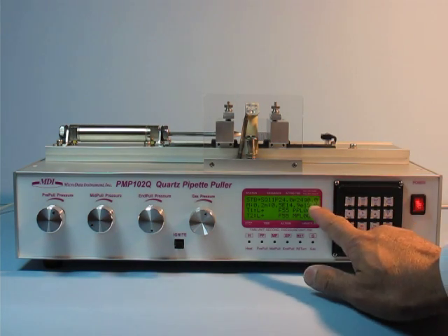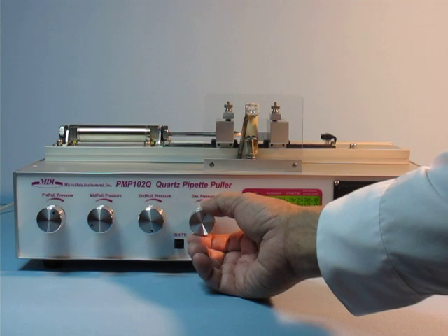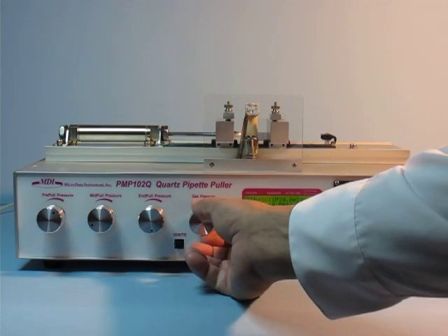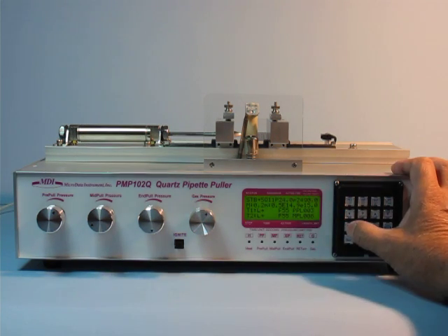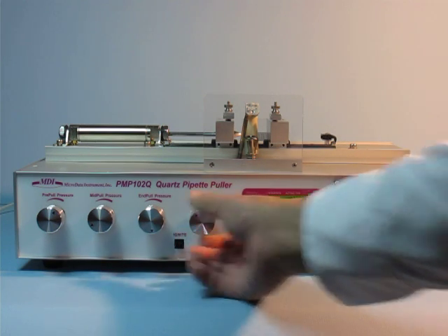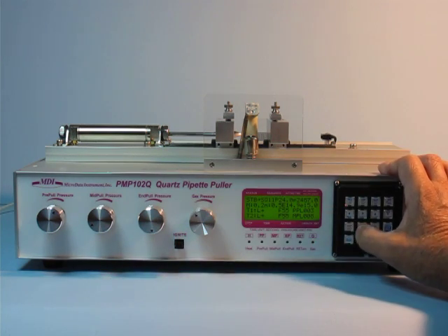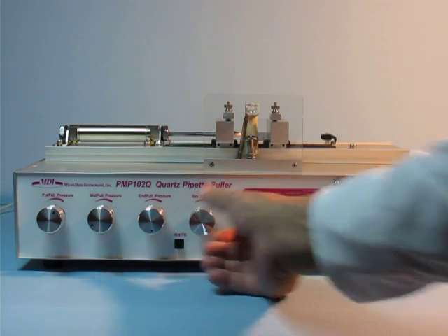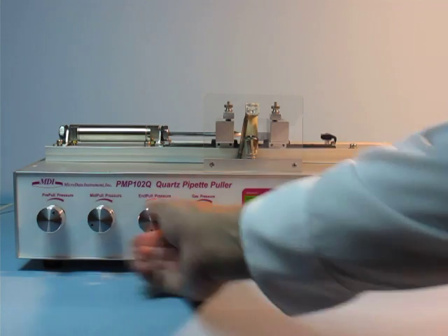You have to make sure the gas pressure is correct. If you check the gas pressure, you have to pass this one, and then the gas pressure is correct. Then you can check the other pressure.